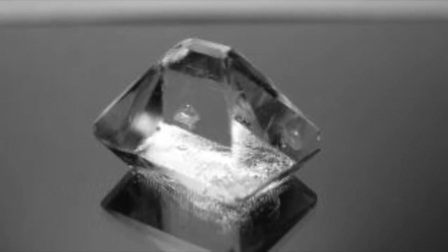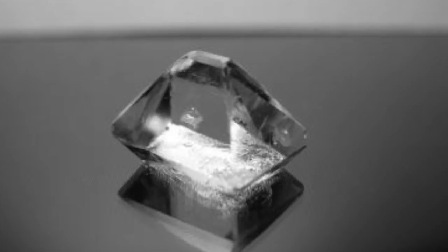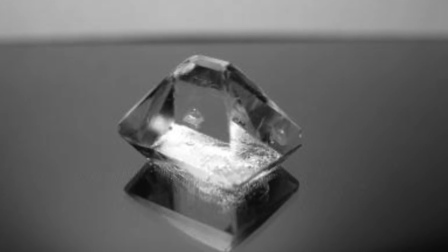Lowering the temperature will cause the solubility to go down. This changes the equilibrium and causes many little crystals to crash out of solution. After those many initial formations, the goal would be for one giant alum crystal. So after lowering the temperature briefly, I would store the crystals at room temperature so that other particles latch on to the newly formed crystal, causing one giant one to form from the jump-started little crystals.